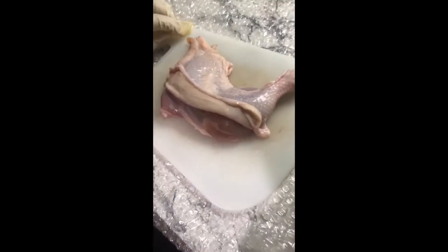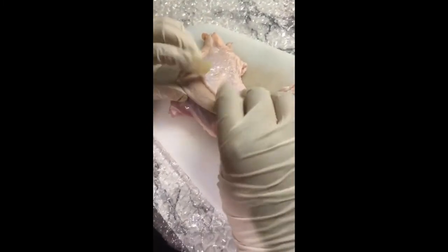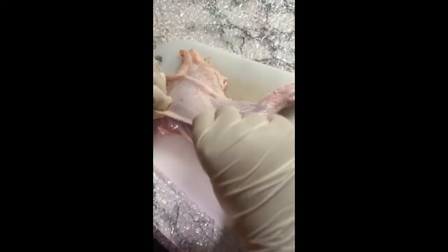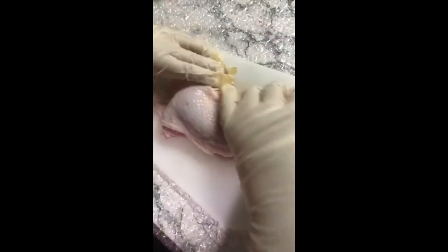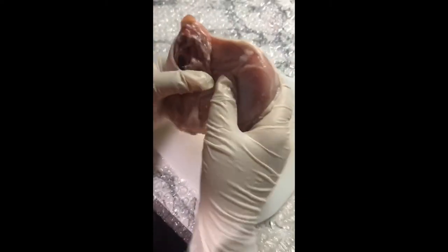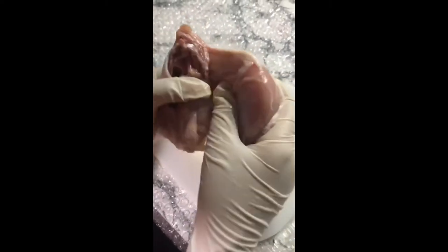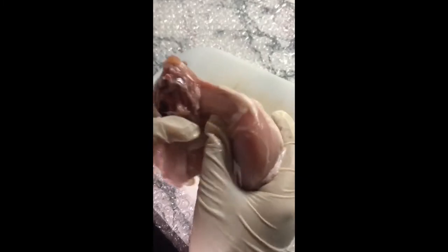Let's get dissecting. The first thing you will notice is the skin. Now let's pick up the chicken leg and see how it bends. These here are called joints — this part where two bones meet.